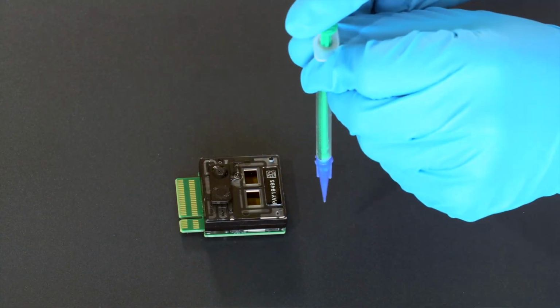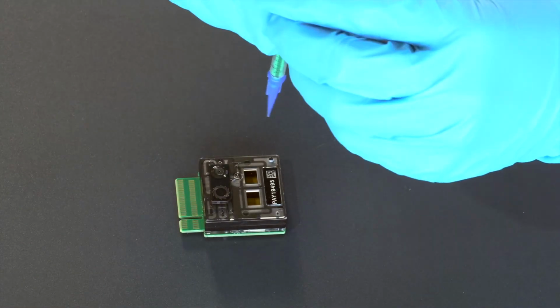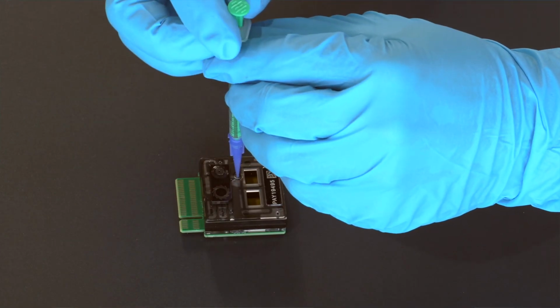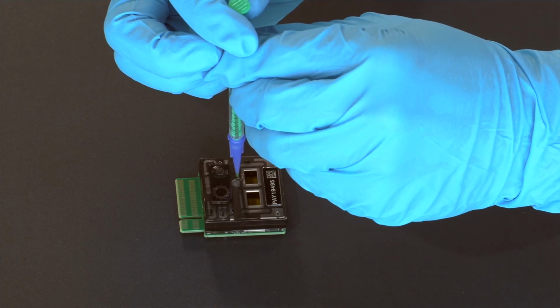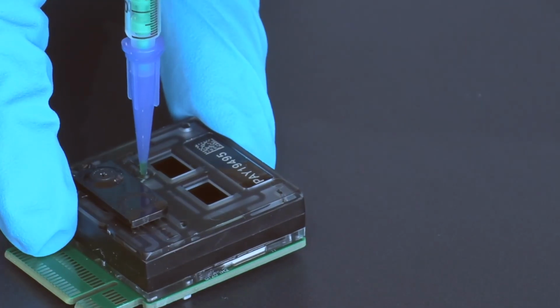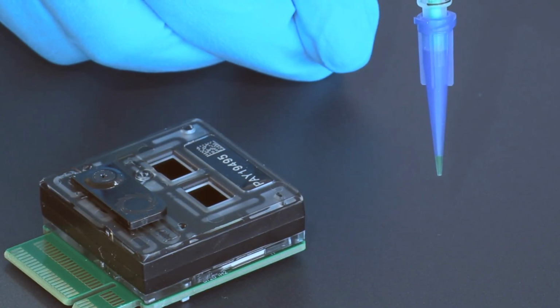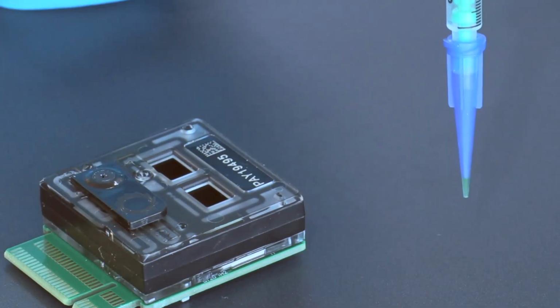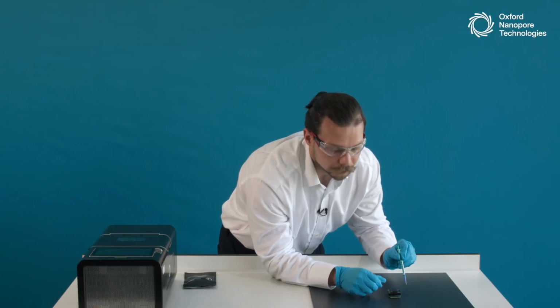To do that, I will make sure I press the plunger of the syringe to the very bottom, and we insert the syringe into the flow cell, and very carefully, using our thumbs, start aspirating liquid up. And as we can see, we have a little bit of storage buffer enter the pipette tip of the syringe, and this suggests we have successfully removed the air bubble and actually reached the storage buffer that was inside. At this stage, we're ready to do the flow cell priming.